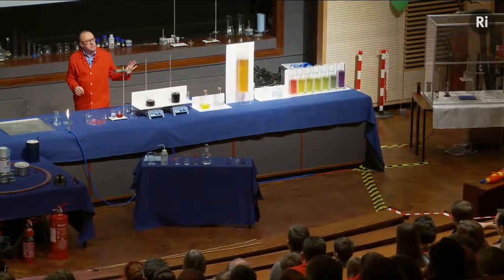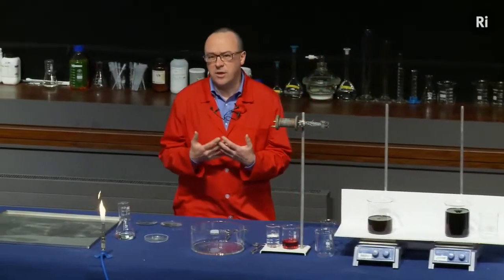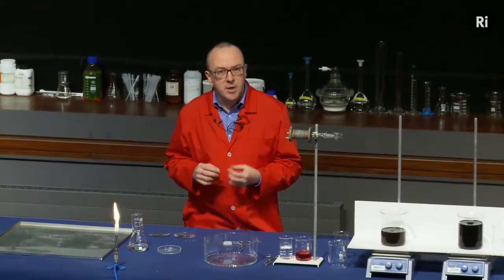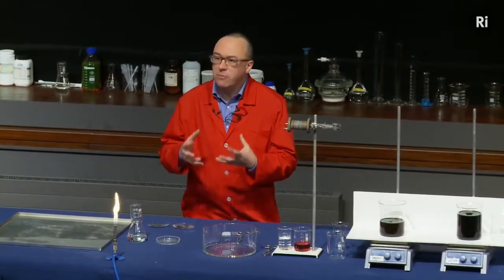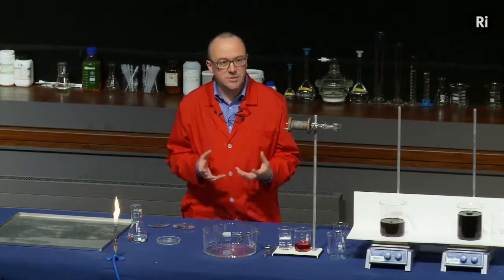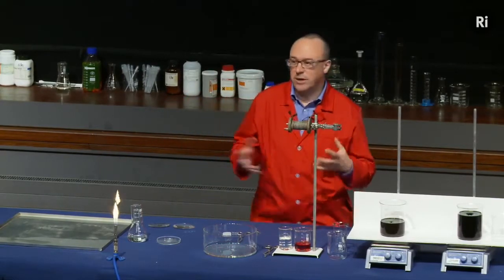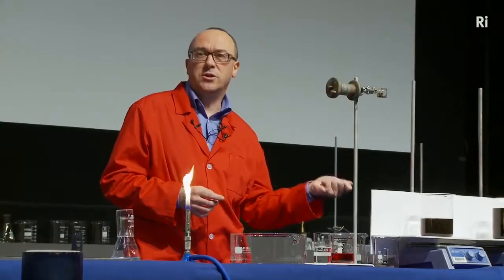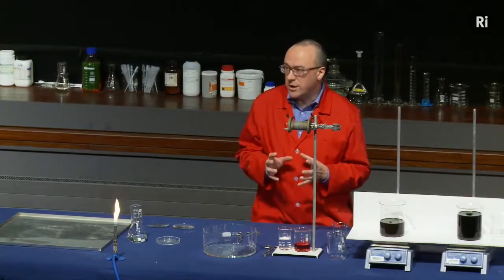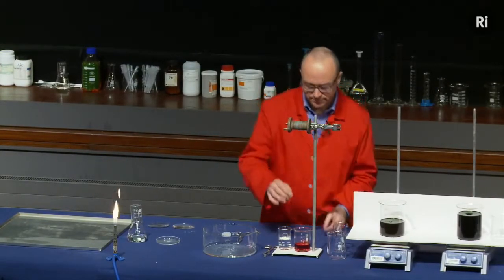So in the reactions we've seen so far, we mix chemicals together and we know that a reaction has taken place because we get a change of colour. But there are lots of other ways that a chemical reaction can show up. One way is called a change of state. The state of something just means whether it's a solid or liquid or gas. So if something turns from a solid to a liquid or from a gas to a solid, then it's changed state. Let me show you an example of a chemical reaction that involves a change of state.